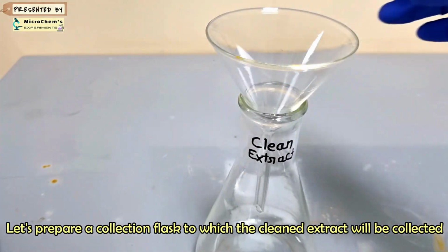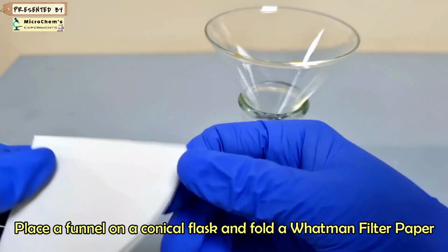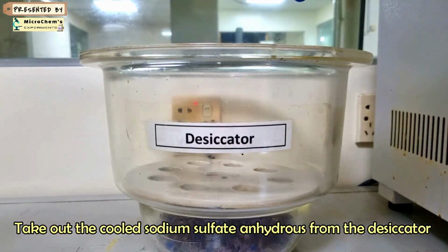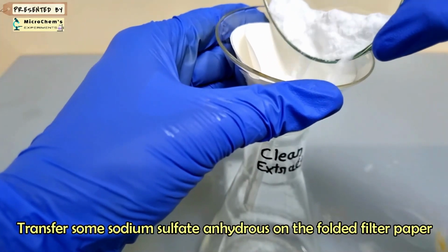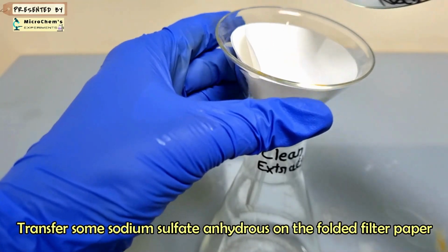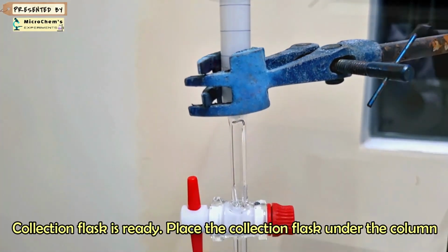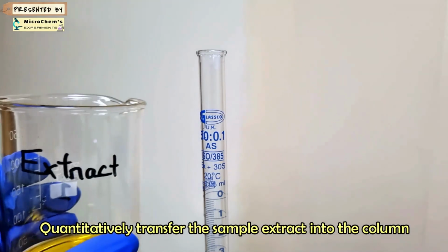Prepare a collection flask using a funnel and Whatman filter paper. Bring the dried sodium sulfate anhydrous and keep an amount of it on the filter paper. Place the collection flask under the column. Now, we will clean the sample extract using the newly prepared column.